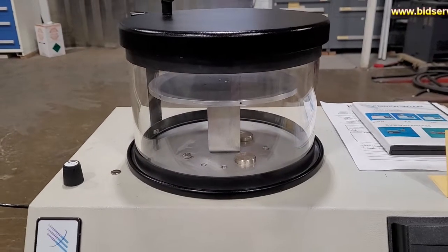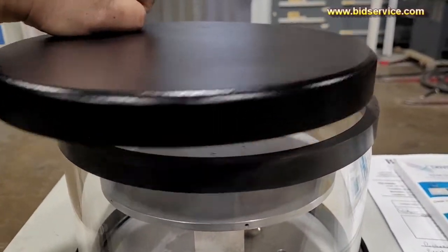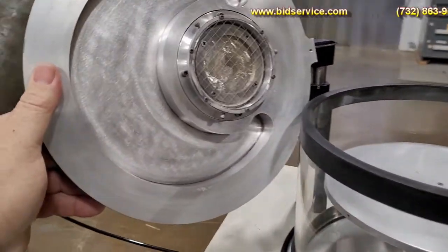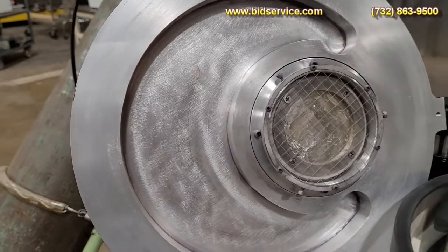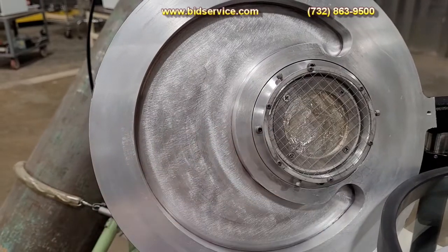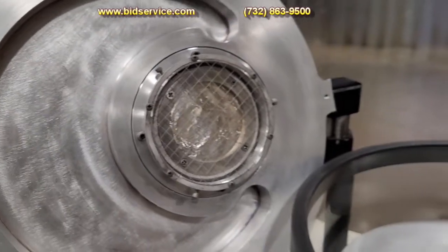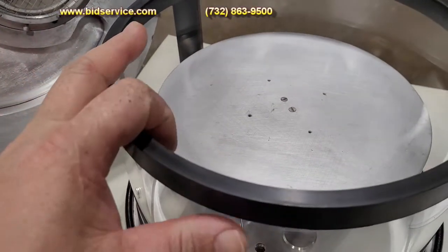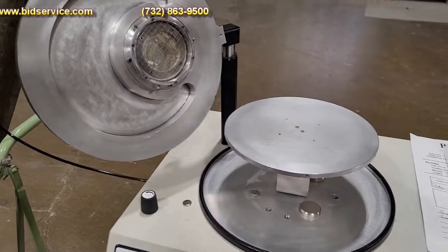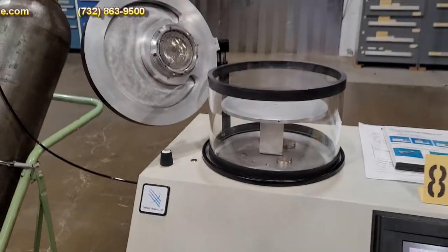So this system's at atmosphere right now. Basically, what you want to do is lift up on this, slide it over, and then you can lift this up. You can see the cathode there — we got a piece of aluminum foil on there, and now you can see that it has been etched away. There's your bottom of your button, here's your whole chamber that comes up, and that is your whole system as a whole.